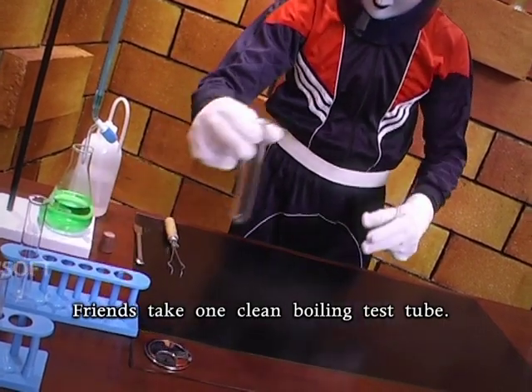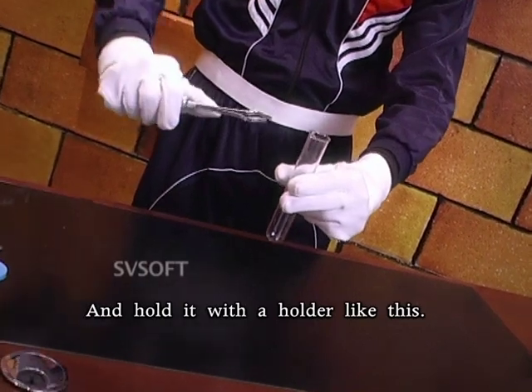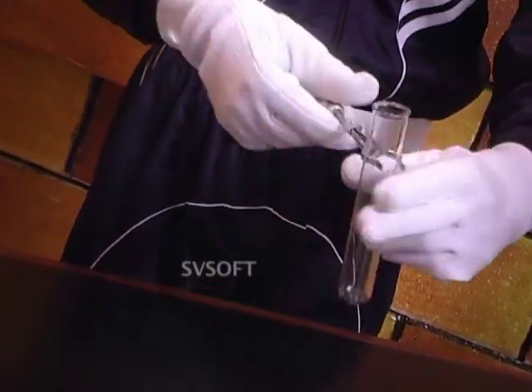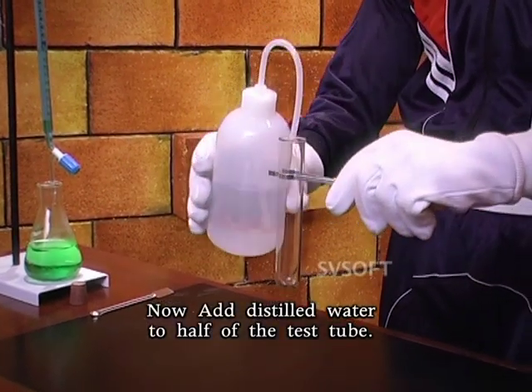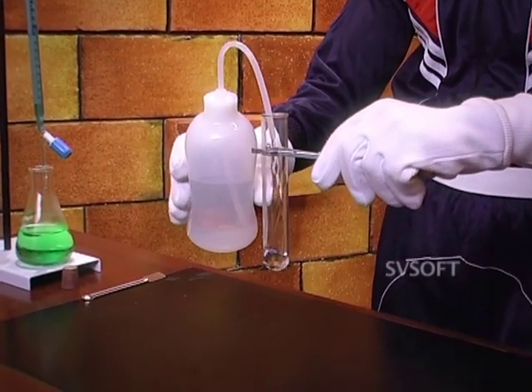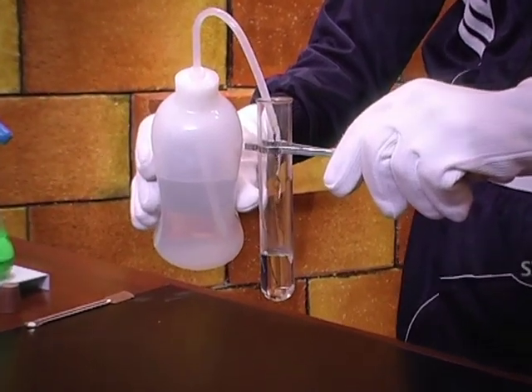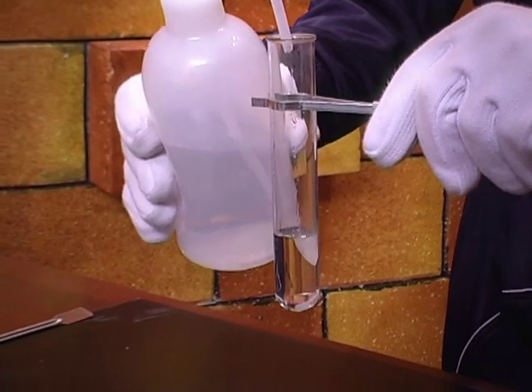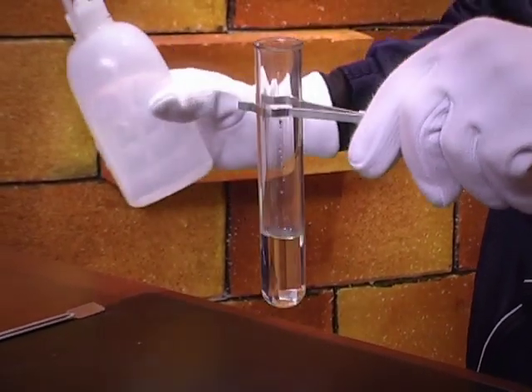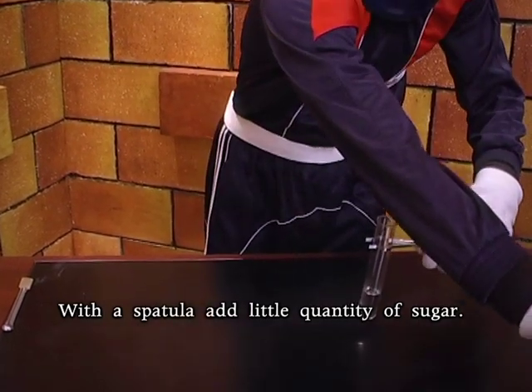Friends, take one clean boiling test tube and hold it with a holder like this. Now add distilled water to half of the test tube. With a spatula, add a little quantity of sugar.